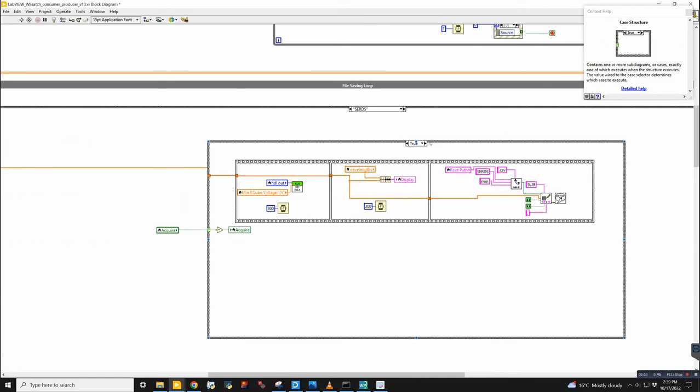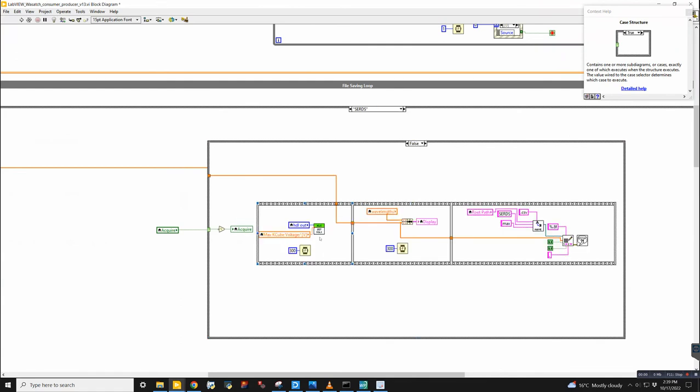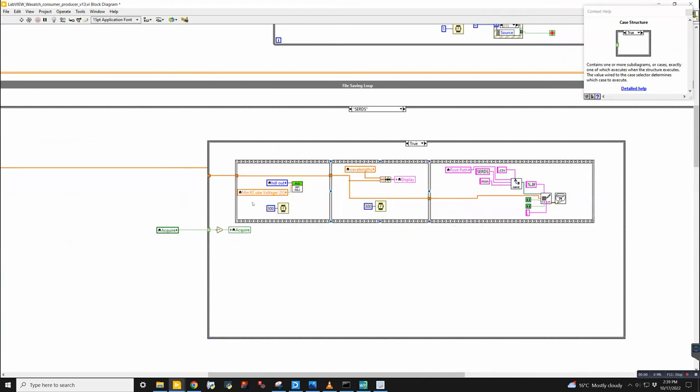So I think that needs to be modified. But the idea here is basically you take one spectrum and then you change the K cube voltage and you save another one. So here you have the max voltage, and then you take a spectrum and save it. And then in the other case, you take the minimum voltage and do the same thing. So you have 2 different files for SERDS. So we click one acquire and it does the true and false itself. Yeah.